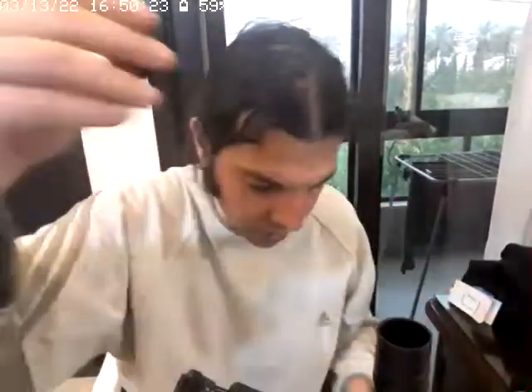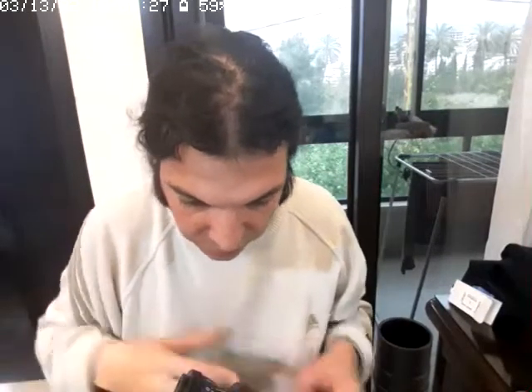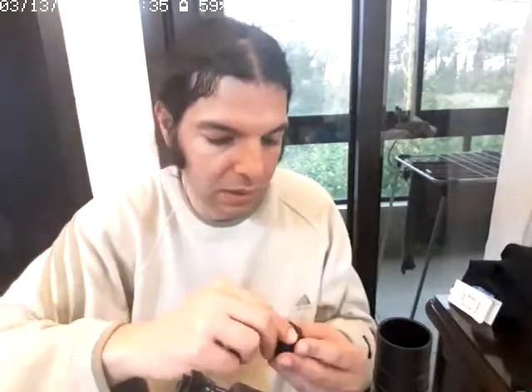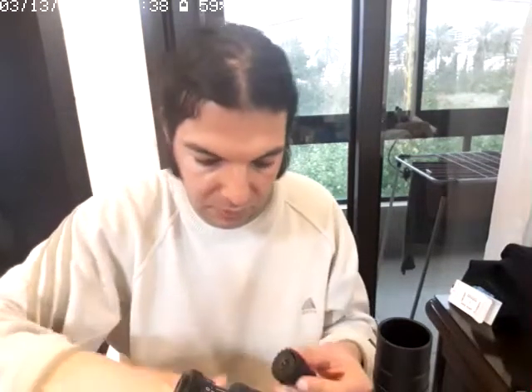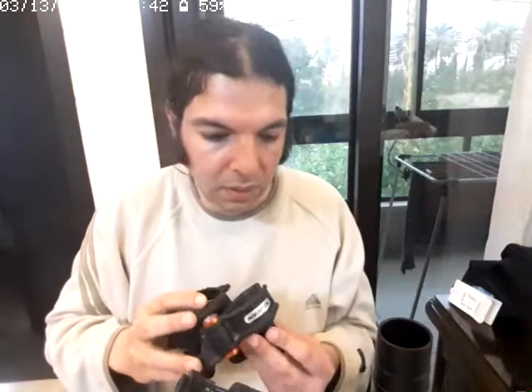So we're going to use this, and not this. We're going to use this here. This will hold all the eyepiece. And then we're going to use this. By the way, the color filters don't sit under the microscope eyepiece.